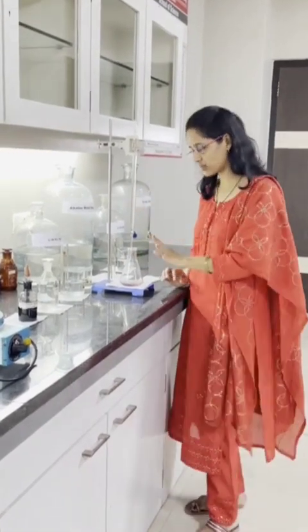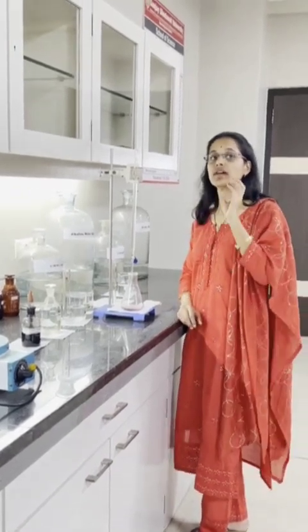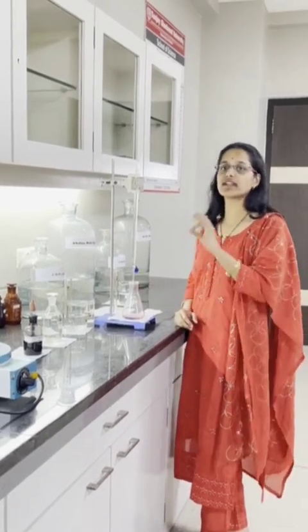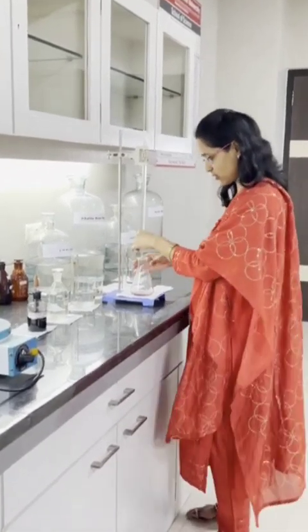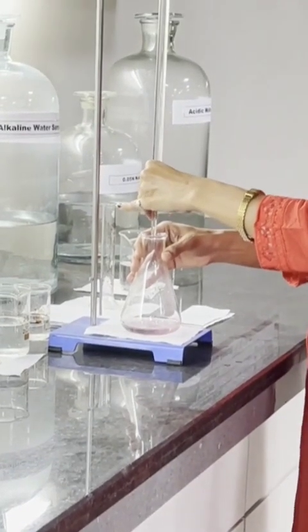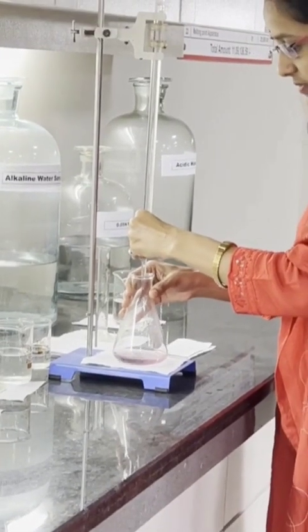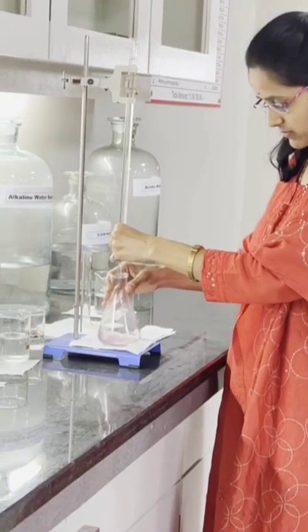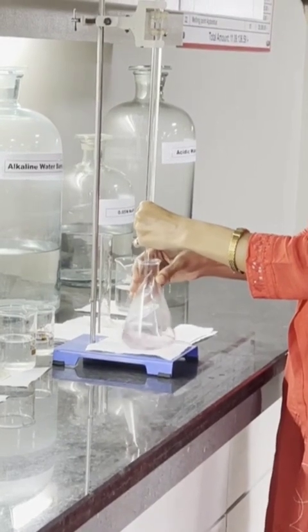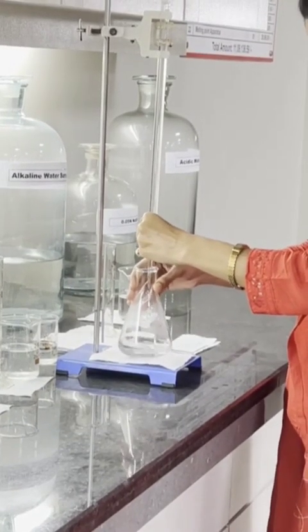This is the permanent hardness because we have taken boiled water. As the water is boiled, all the salts or temporary hardness-causing agents are removed. So only permanent hardness remains — meaning chloride, sulfate, and nitrates of calcium and magnesium are there in the conical flask. We have to titrate the water sample with EDTA. The end point is the same: wine red to sky blue.